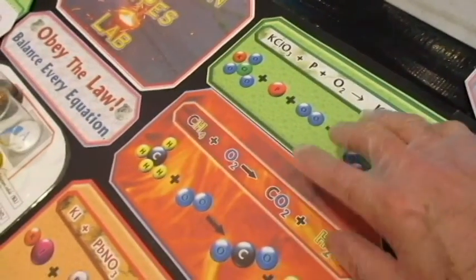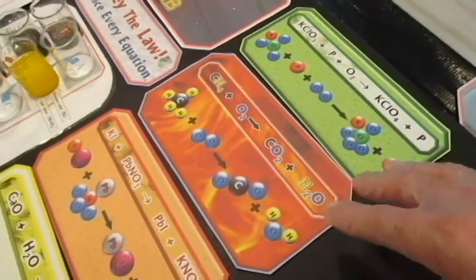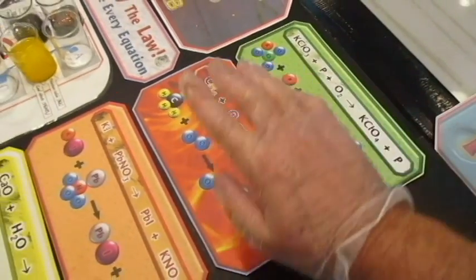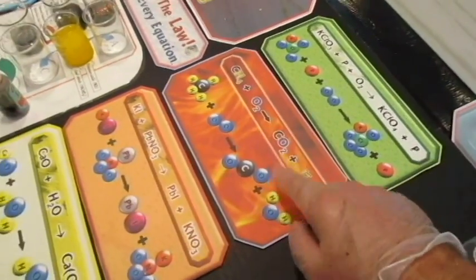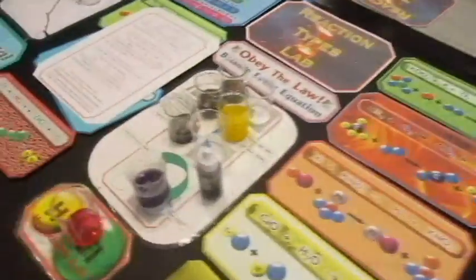These are the ones I had up because these are other reactions we want to classify. So I'll be doing those demos. Those are all part of this lab with the match and the stovetop, which would normally be a Bunsen burner. Then we'll use that to light the magnesium. So remember, all of those reactions are considered part of this lab.